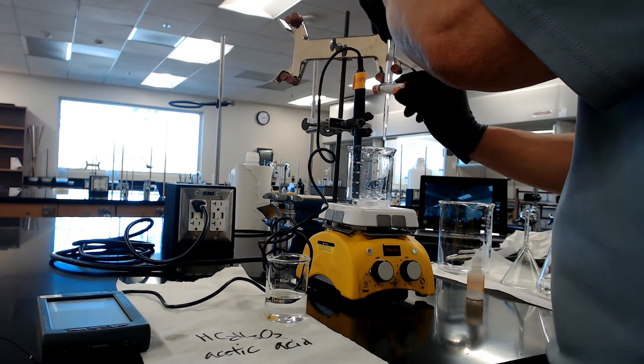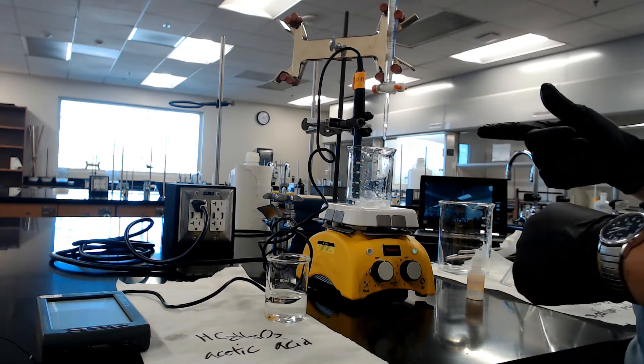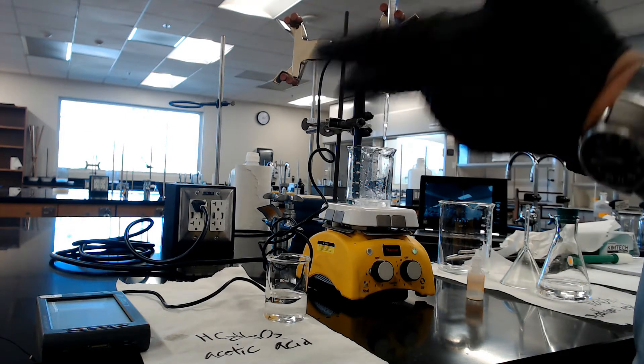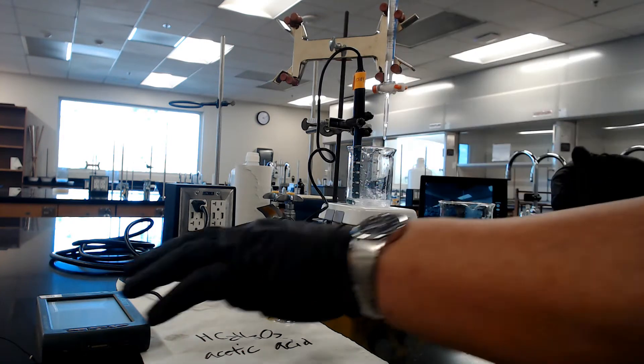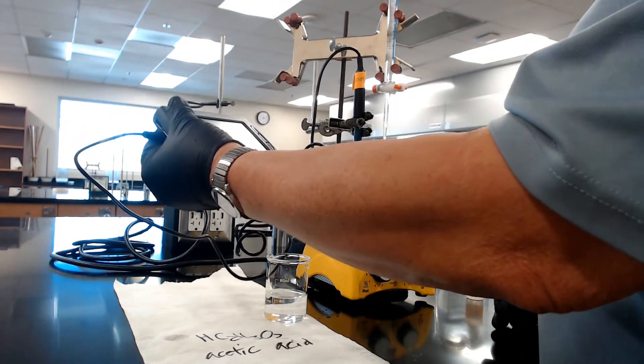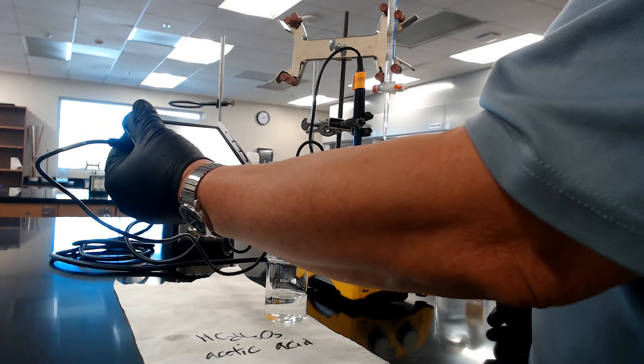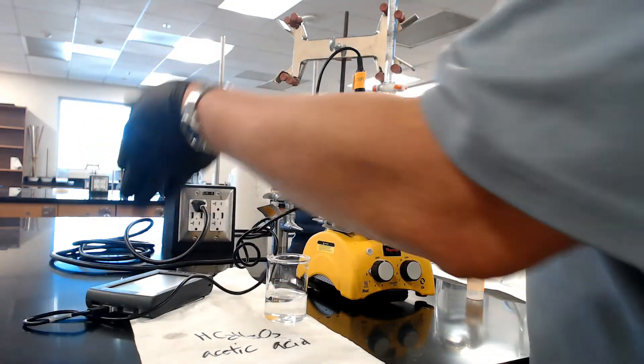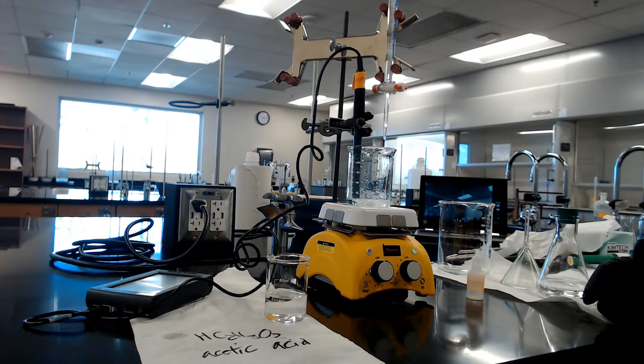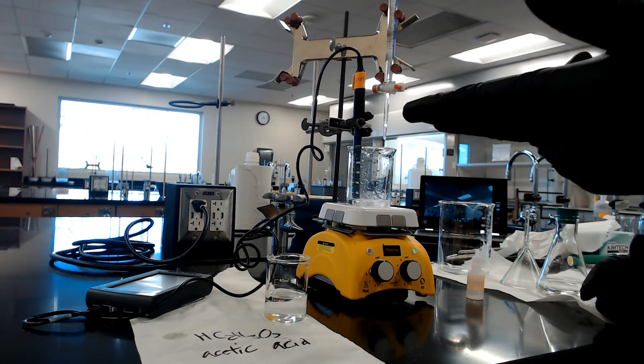You notice that it turns pink kind of, but then it does not. We got half of it in there. Now the acid and the conjugate base are the same concentration. pH equals pKa. Go read the pH meter, and yes, indeed, it's about 4.72. Very good. Experiment over. That was simple, right? Notice that it didn't turn pink. It's not supposed to, because the indicator would trigger at about 7.8. We're done.